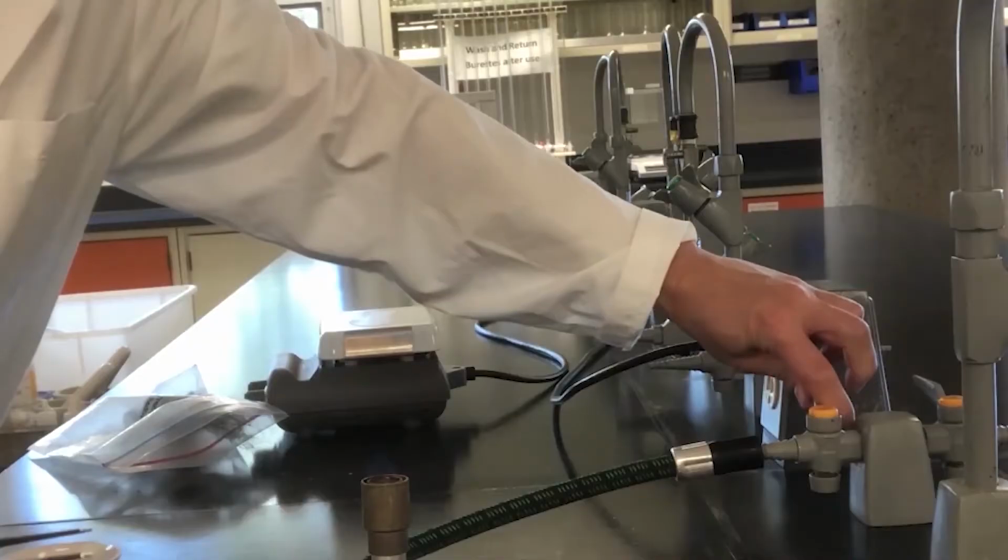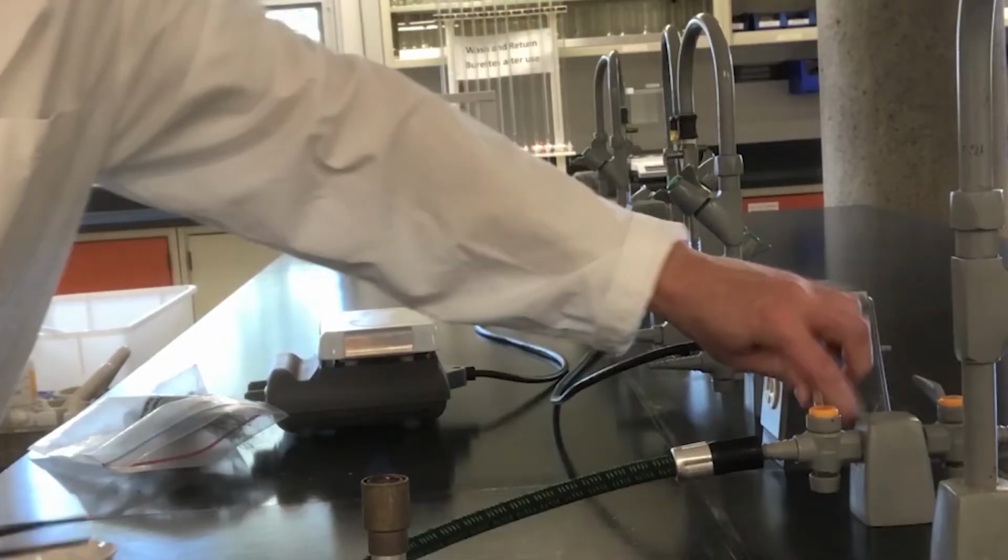When done with the Bunsen burner, turn off the gas flow. The tap is perpendicular to the line of flow. In part 2, this is the reaction of metal with water.